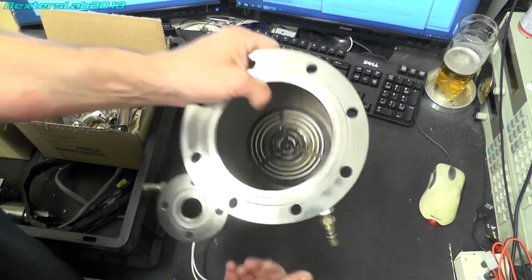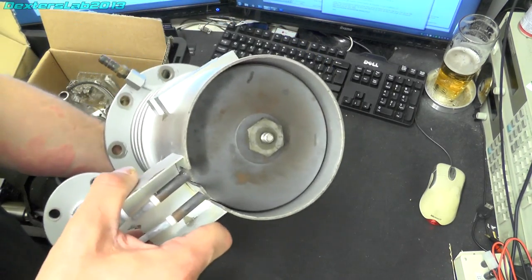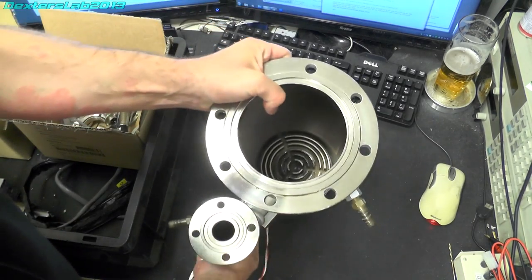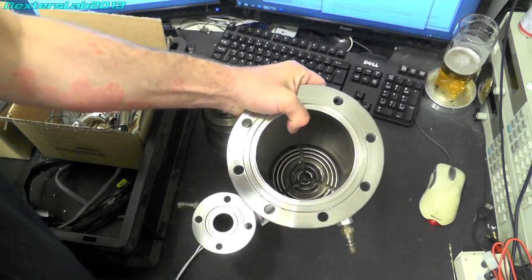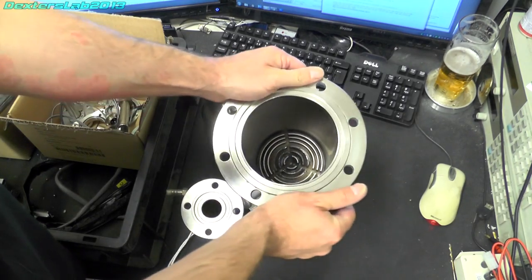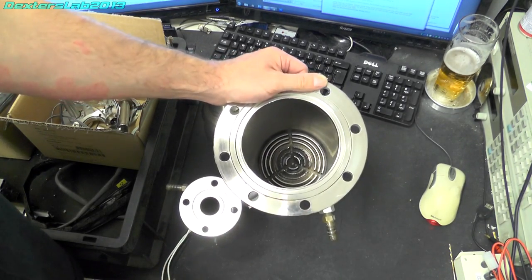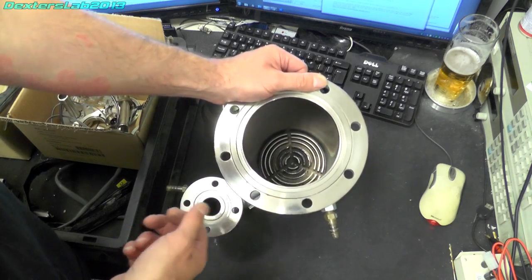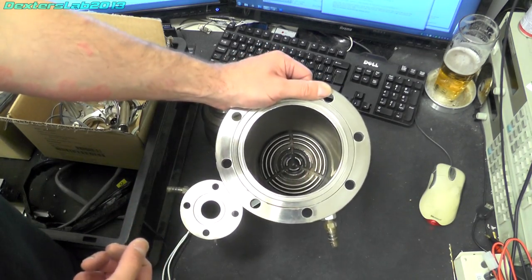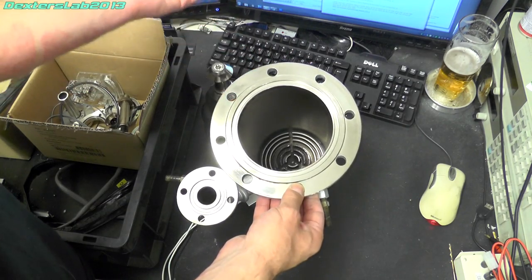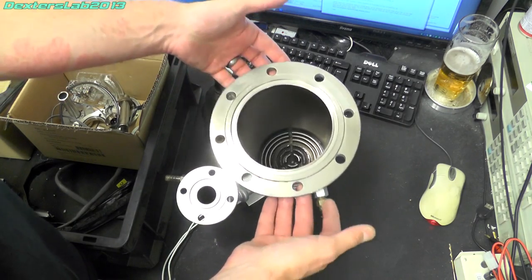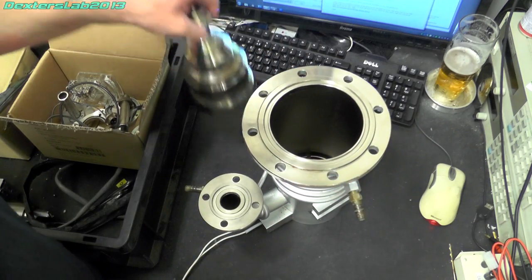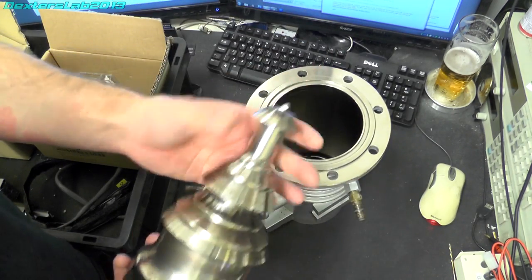And then underneath that on the base we have a large heating element. And the way these work is the heating element heats the oil up to a couple of hundred degrees. And under the partial vacuum that you start these in, the oil boils off as a mist. And because it's in a partial vacuum it accelerates rather quickly through this arrangement.